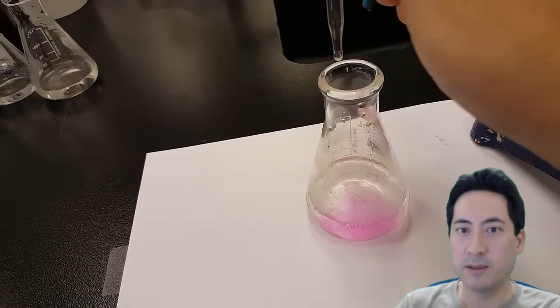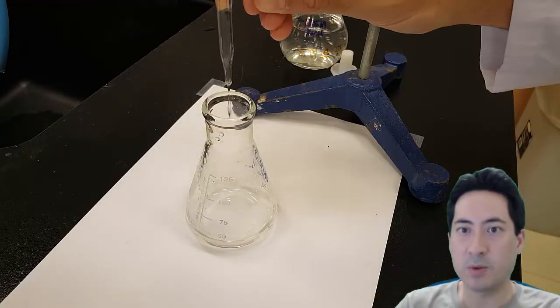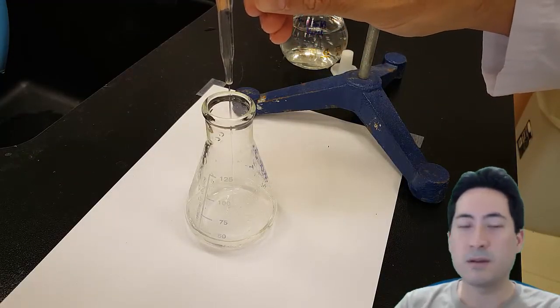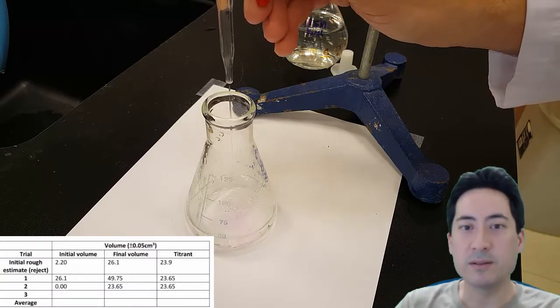And here you can see it's coming out quite fast. And now it's even faster. It's like a mil per second now at that speed, which is pouring out. What I got there was a reading of 23.9 mils.